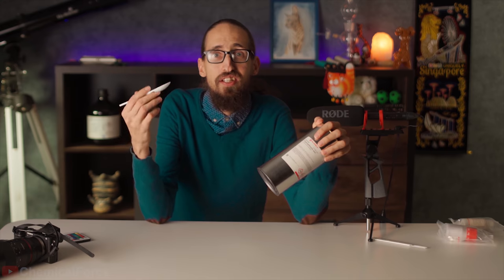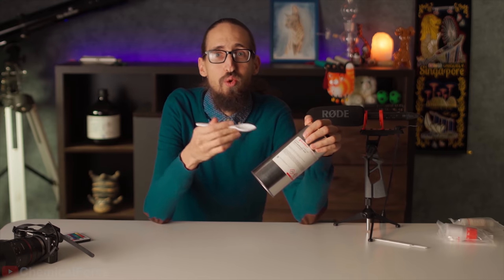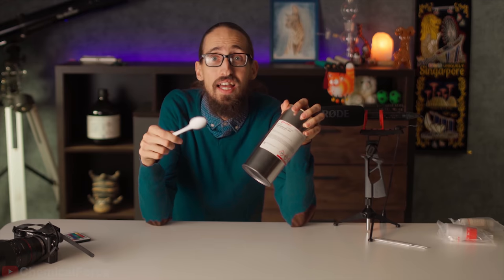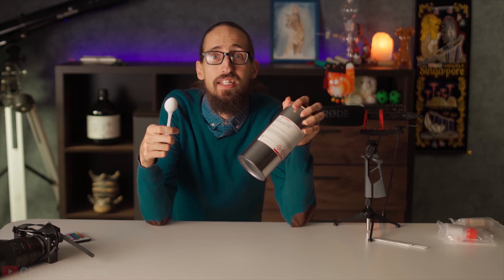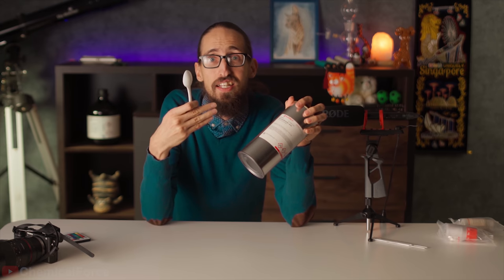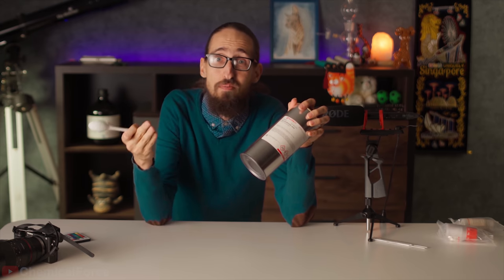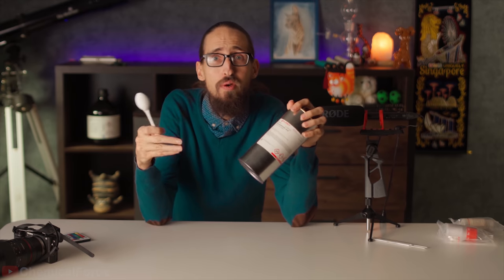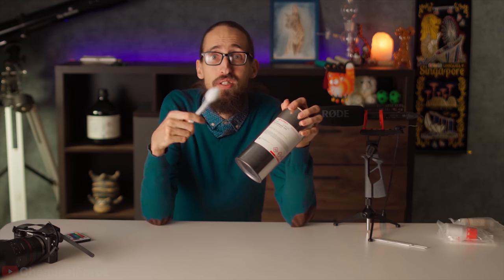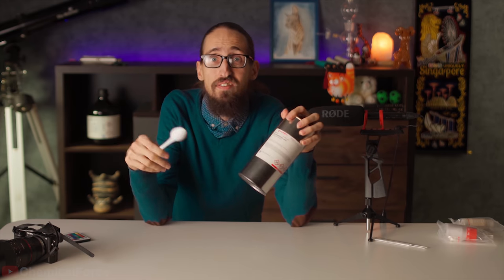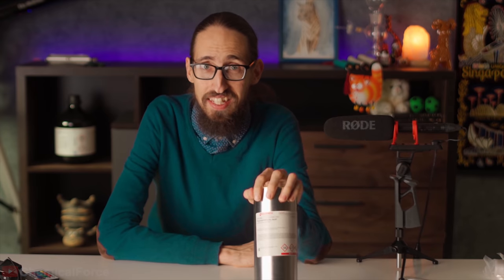Some people in the comments got confused about the acid being stored in a metal can. Well guys, many reagents are packed in this kind of cans to make them more safe to transport and store. However, there is one more can inside the one you see that contains the reagent itself. It's time to open this can.